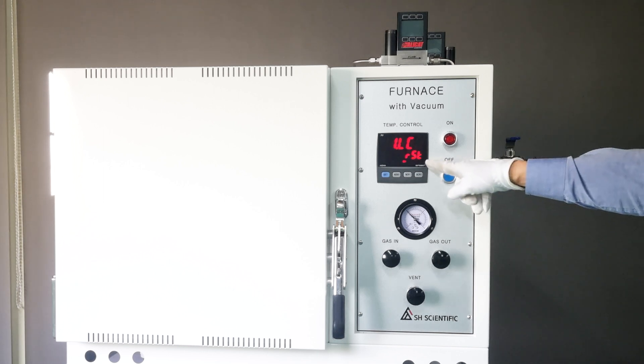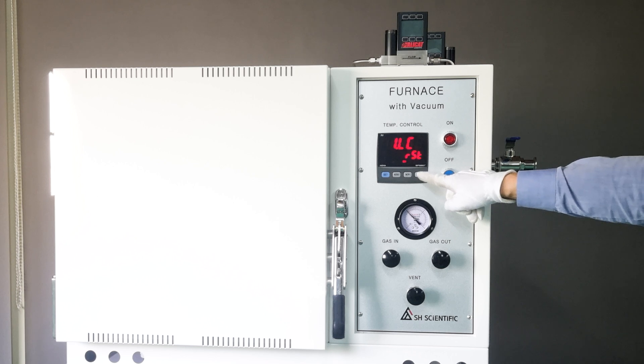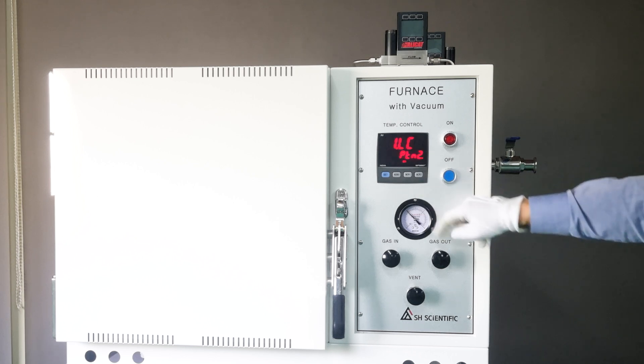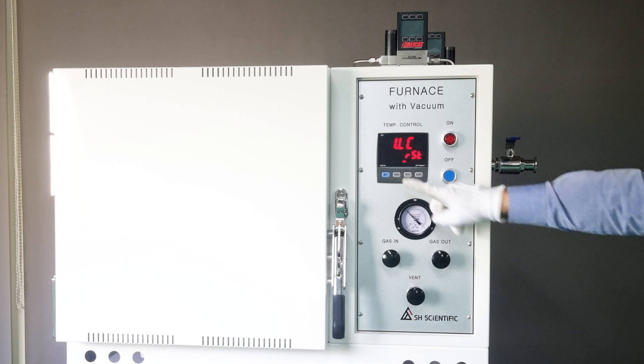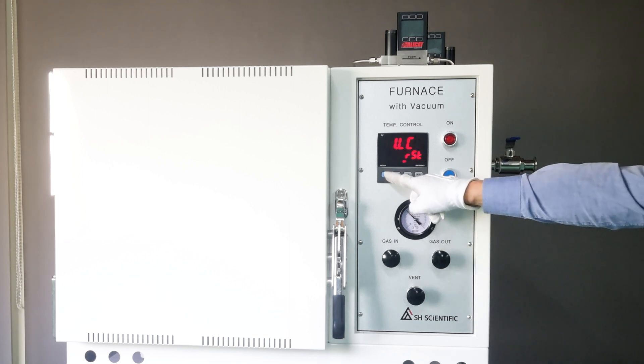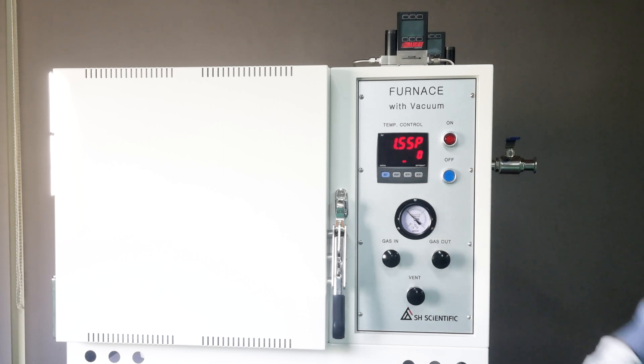RST will stop operation, Hold will hold the temperature, Pattern 1 will repeat Pattern 1, and Pattern 2 will repeat Pattern 2. Here, I selected RST, so the furnace will simply stop when the final step is done.